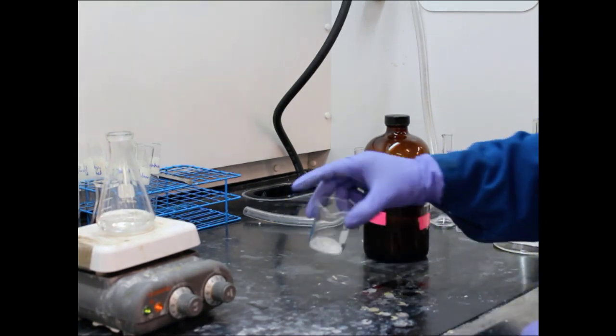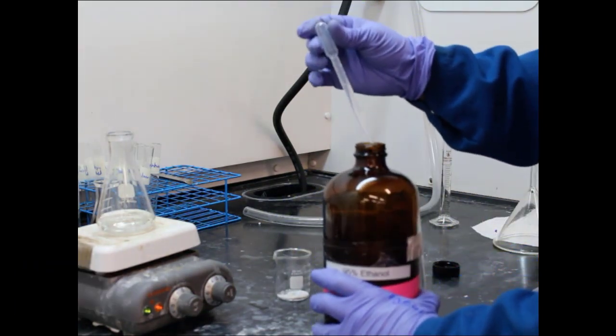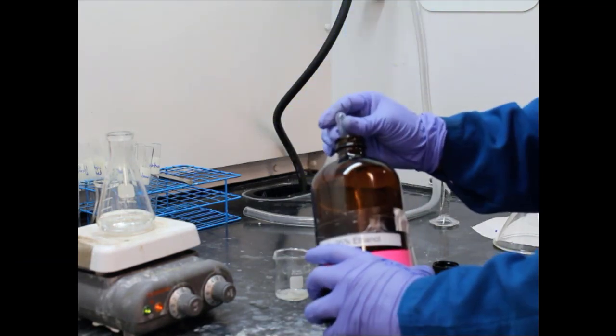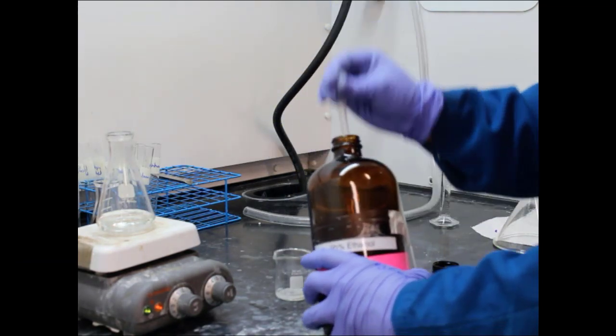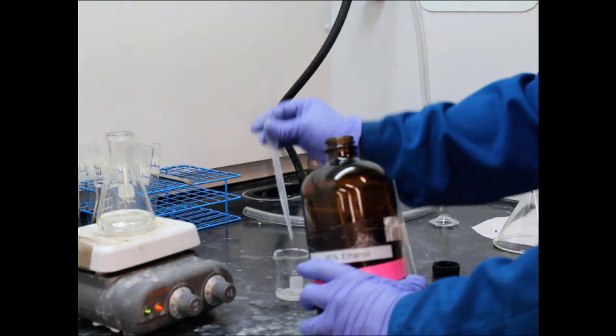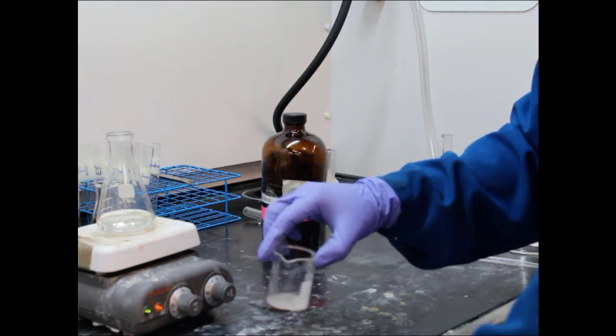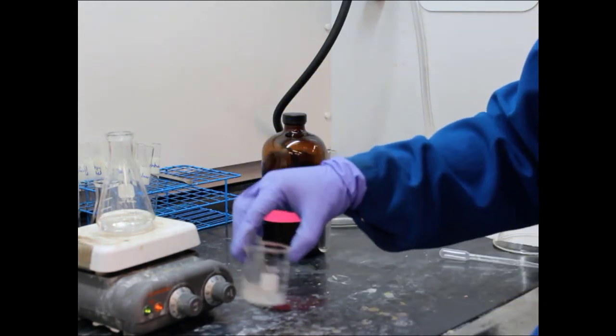So there's about 30 milliliters of ethanol in this Erlenmeyer flask and about 5 milliliters of ethanol in this beaker that has 500 milligrams of unknown. All right, and then they're also going to heat that up to dissolve it.